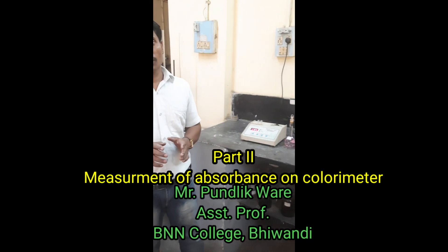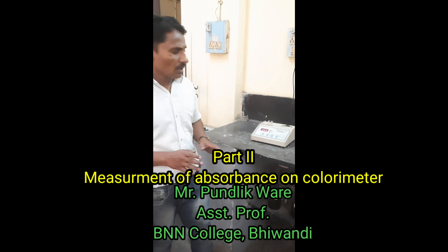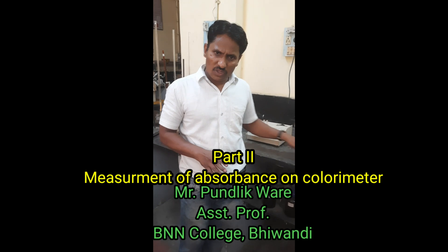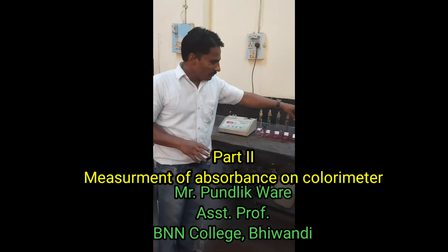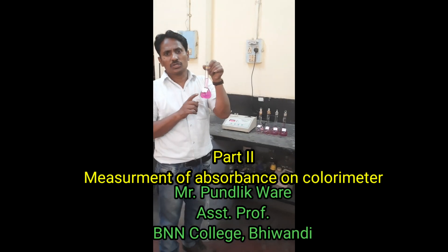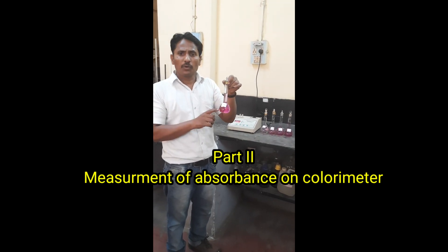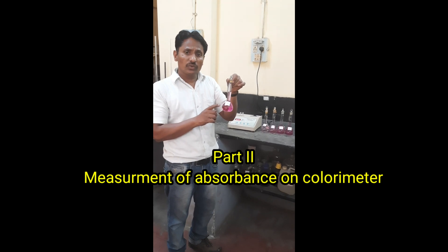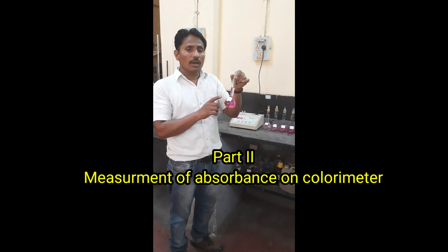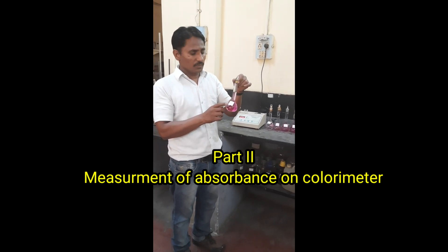We are going to measure the absorbance of each solution. Out of these solutions, the 10 ppm solution is the highest concentration solution. With the help of this solution, we are going to find the lambda max of the solution.